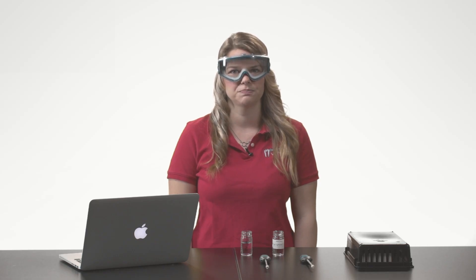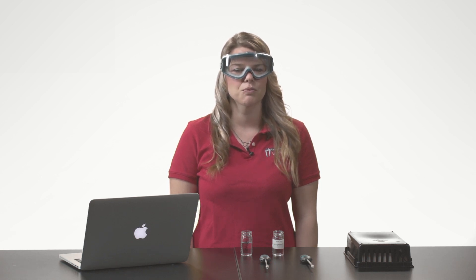In this experiment, you will study temperature changes caused by the evaporation of several liquids and relate the temperature changes to the strength of intermolecular forces of attraction. Here we are going to compare two different types of alcohols: 1-propanol and ethanol. We will also need filter paper and small rubber bands. It is recommended that you do this experiment with two Go Direct temperature probes, but it can also be done with one at a time.